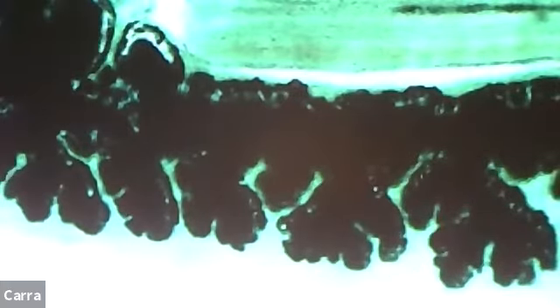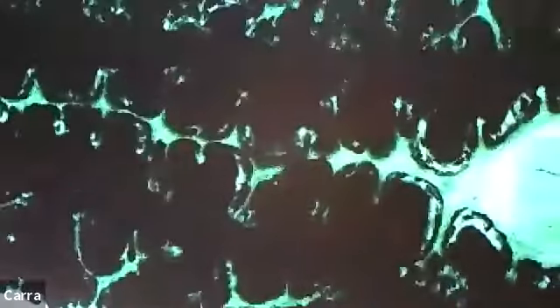So what we're looking at, all these black squiggly lines, is all of the gastrodermis, right? So it's all of the digestive system, and it goes all the way throughout the entire body of this organism. Why is that? Well, that's just because it's distributing all of the nutrients to all of the tissues in the body. And how do we do that as humans?